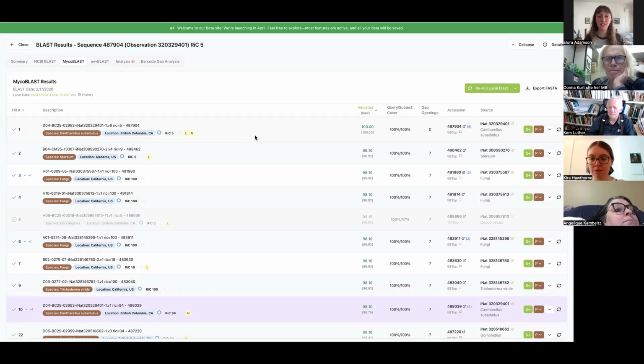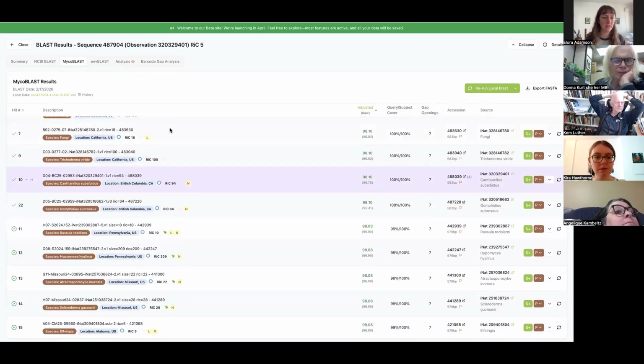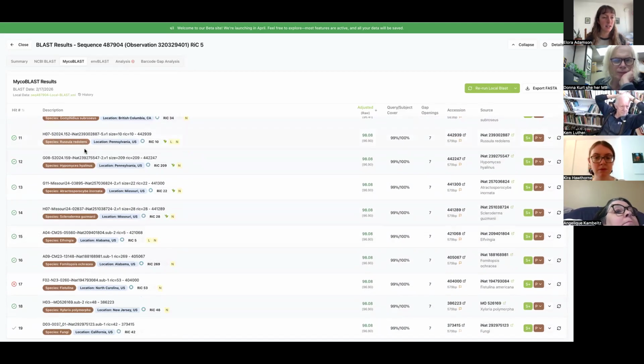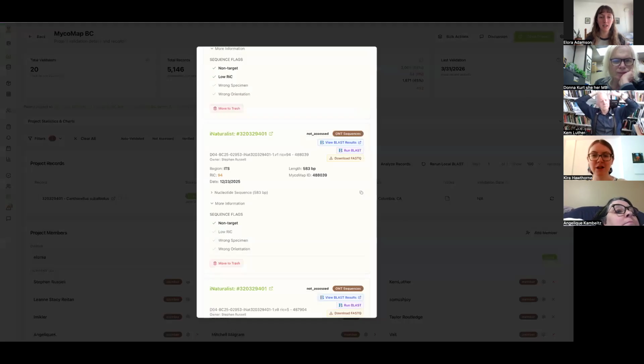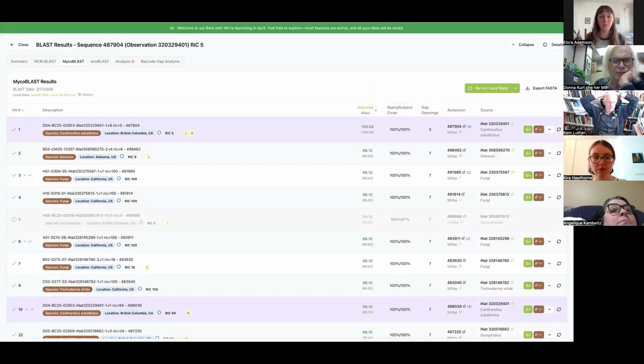Like when doing away with it, it's that sequence. So the record had 9 sequences associated with it, and we're weeding through them and trying to discern if any of them are on target. And so far, no. Okay. So this one, 5 reads, not promising, already looks bad. Russula, hypomyces, scleroderma, like we're done. Not good. It's already been marked non-target. I have a feeling they're all going to be non-target.